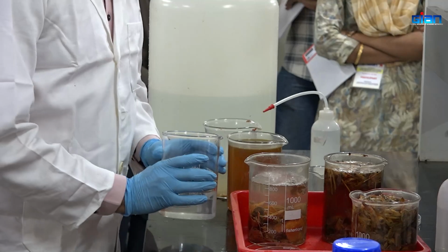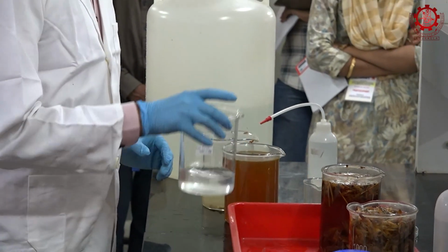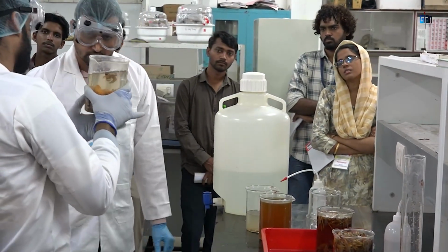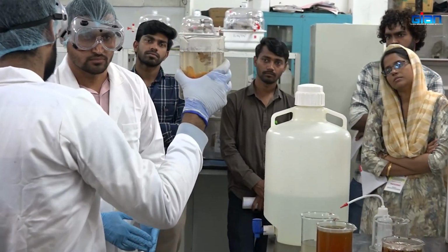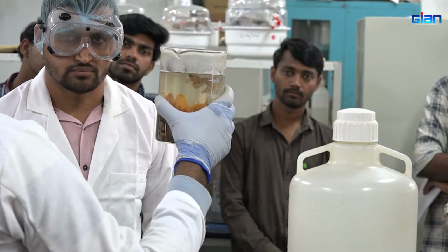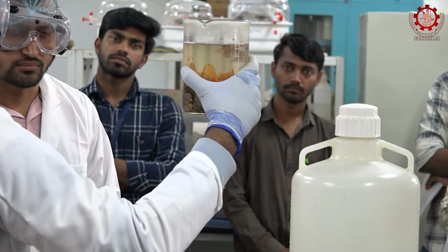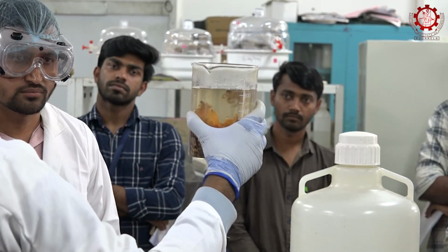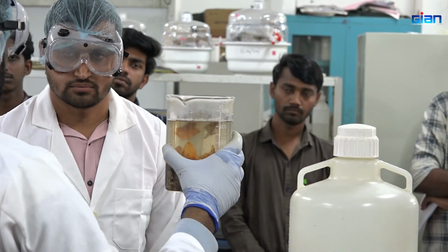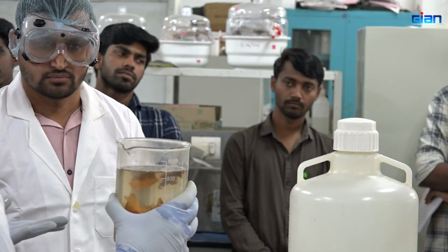Okay, so we have added it, and we can see the color might be changing. If an acid fraction is there, it will be reacting, and again gas bubbles will be going. Some dissolved gas bubbles present in the vacuoles or in between the cells will also be released. By tomorrow we can see the protein which will be separated. So the white fraction will be there, the protein which is dissolved in the NaOH solution.